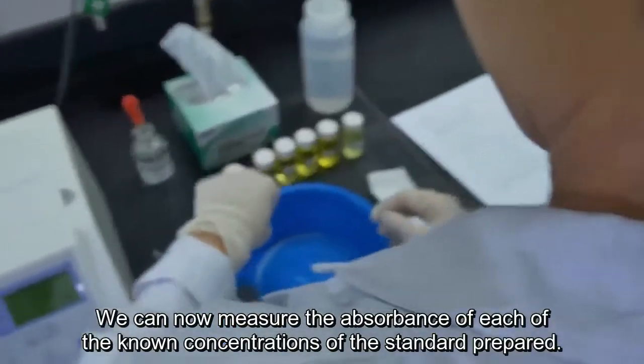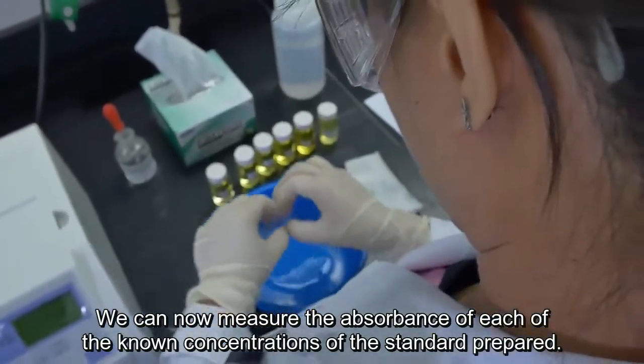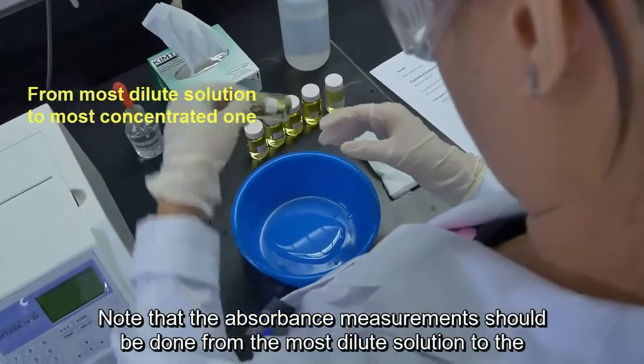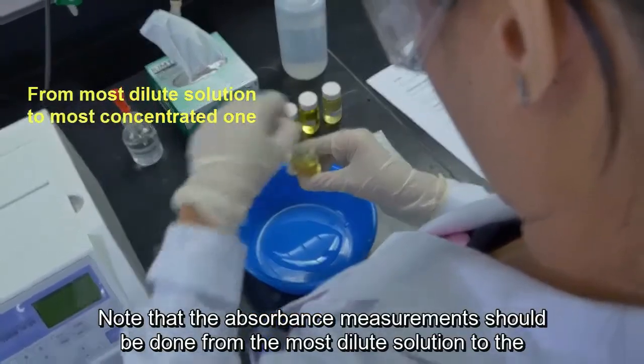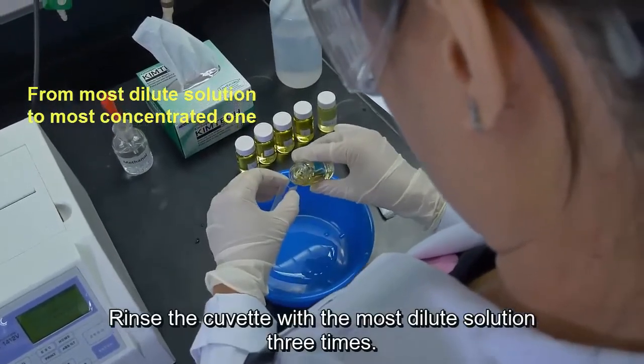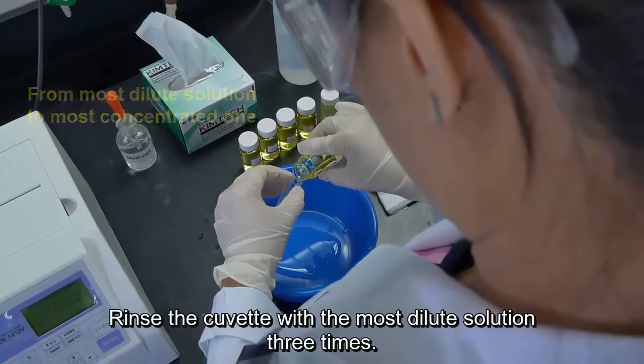We can now measure the absorbance of each of the known concentrations of the standard prepared. Note that the absorbance measurements should be done from the most dilute solution to the most concentrated one. Rinse the cuvette with the most dilute solution 3 times.